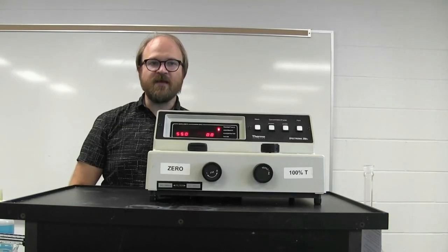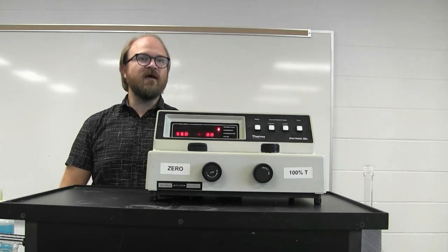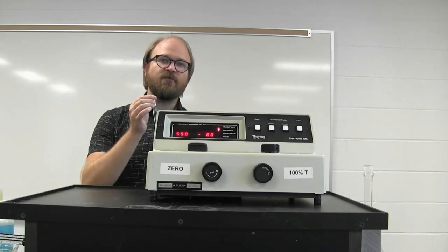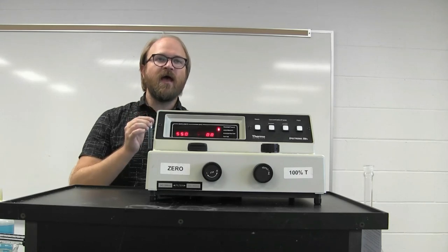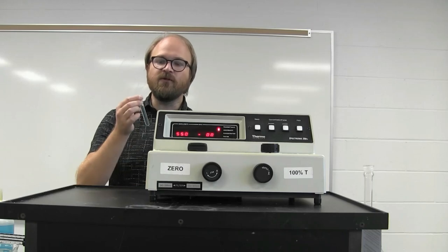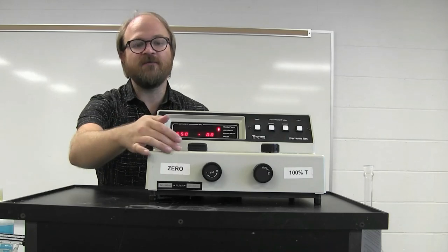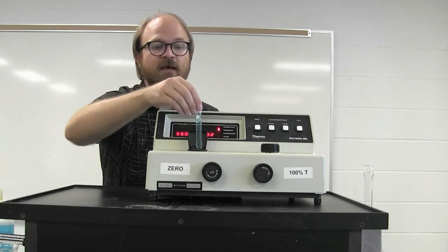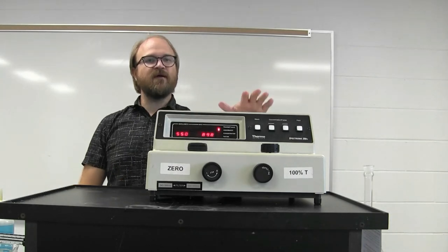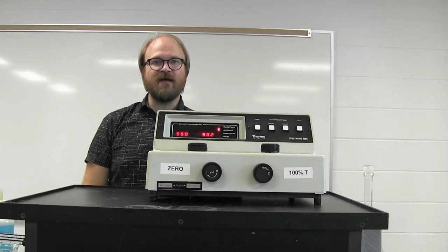Light that interacts with the sample is measured using a spectrophotometer. This instrument gives a certain amount of light that passes through the solution, and the amount that gets through is measured on the other side. The solution itself is placed in a special test tube called a cuvette, which is then placed in the spectrophotometer, and the resulting percent transmittance — the amount of light that passes through to the other side — is measured.